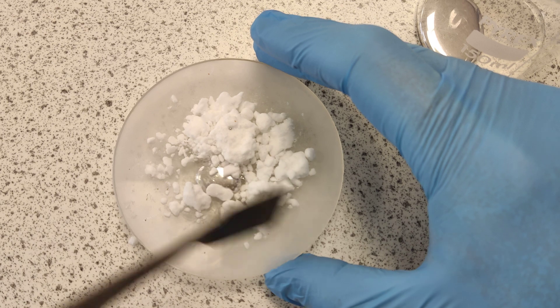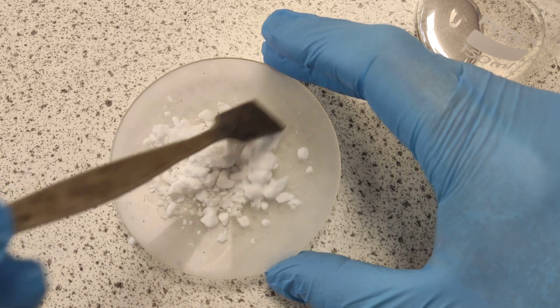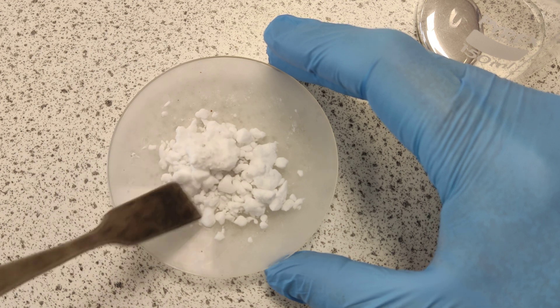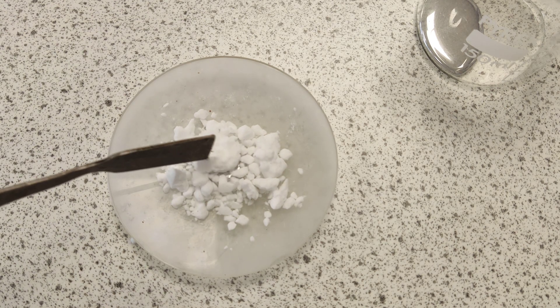Let's think about what the dry ice is doing. The dry ice wants to sublime, and it should be absorbing that thermal energy — that internal energy — in the mercury. And the question is, what am I trying to make? Could take a while. Let's see.